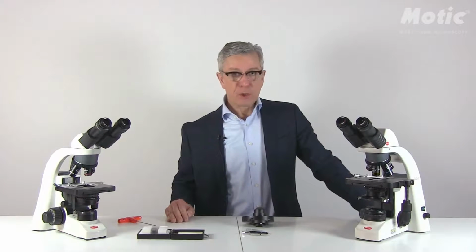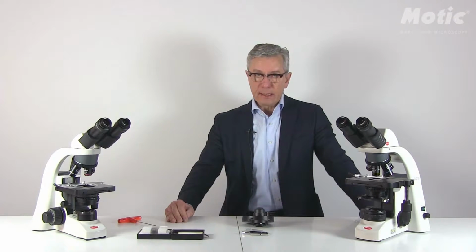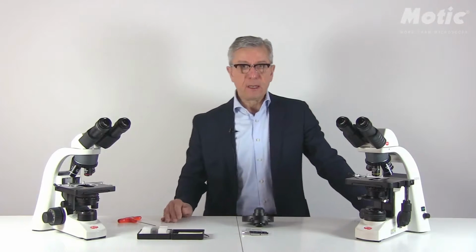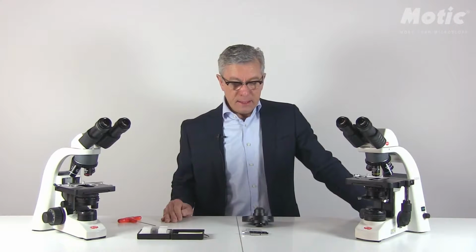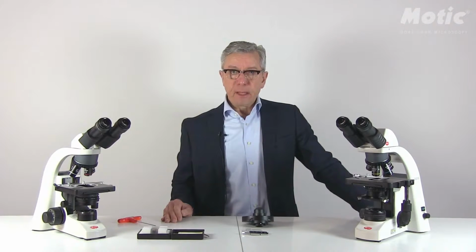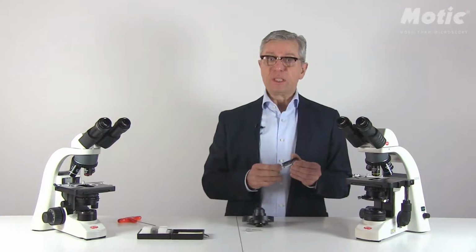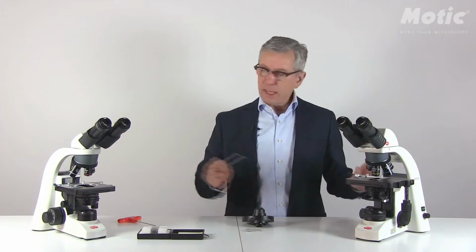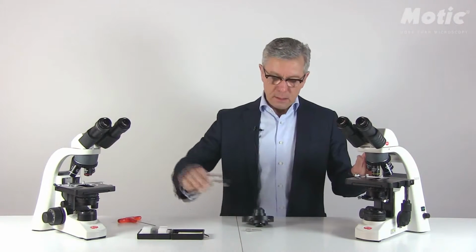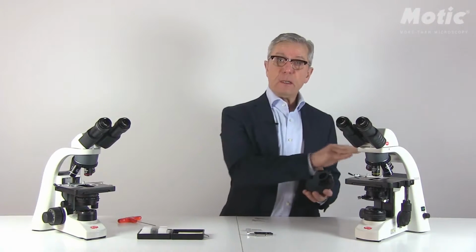Today I'd like to show you some details about our dark-field solutions in our series of BA upright transmitted light microscopes, BA210, 310 and 410, respectively the elite versions of those models. In these cases, dark field can be applied in two options. The simple and the more economic one is to use a dark field slider. This dark field slider has to be combined with the standard condensers of BA210 and 310. The more elegant turret solution works with the 310 and the 410.